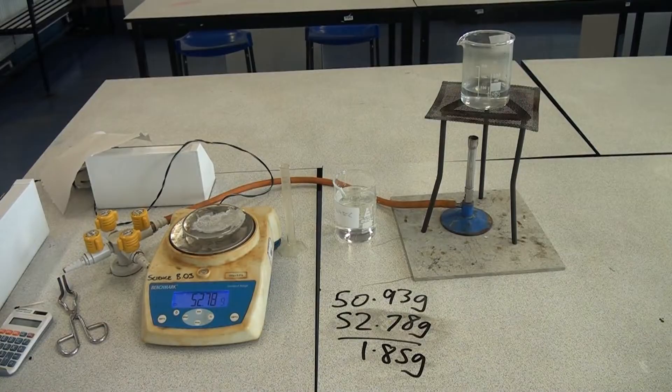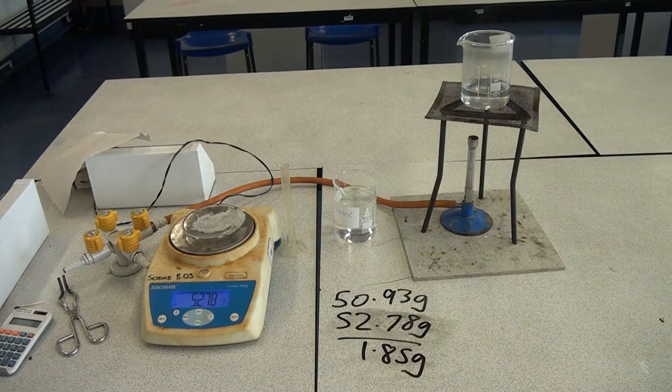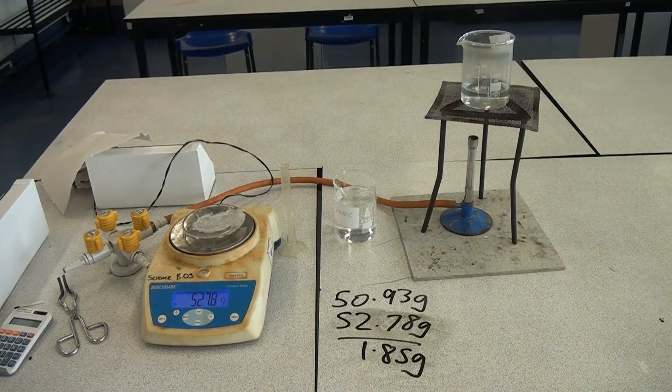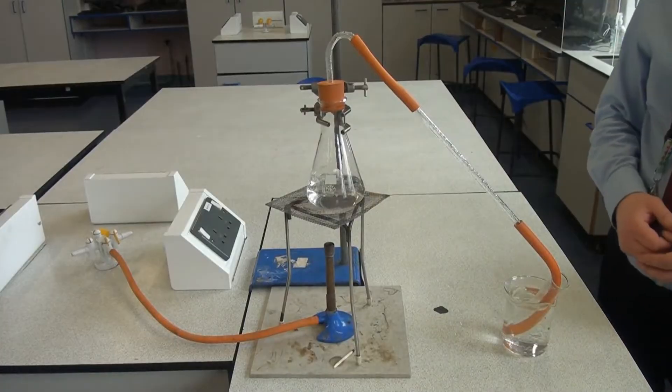We're now going to try and use simple distillation to extract pure water from that sample of seawater. So I'm now carrying out simple distillation on a sample of seawater.